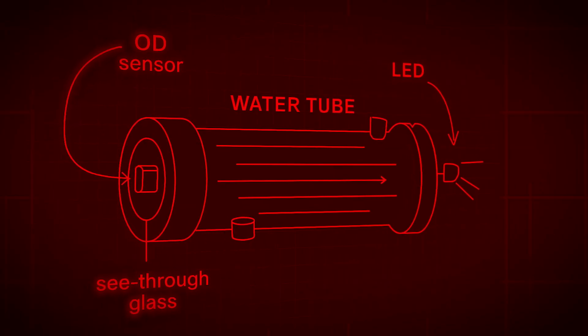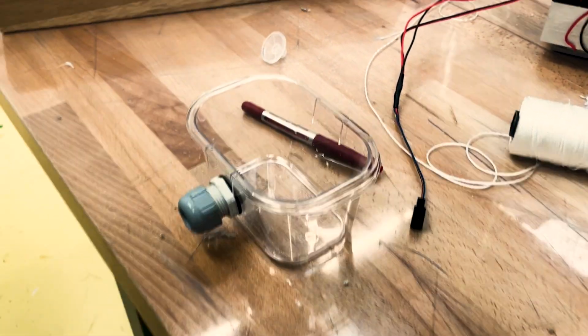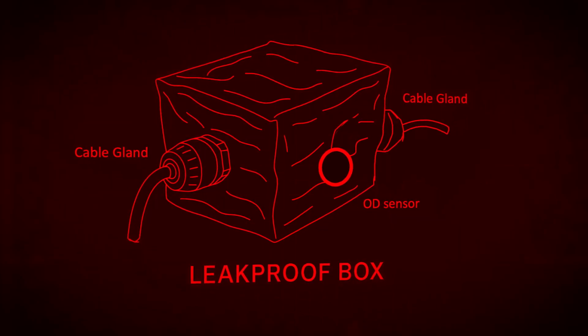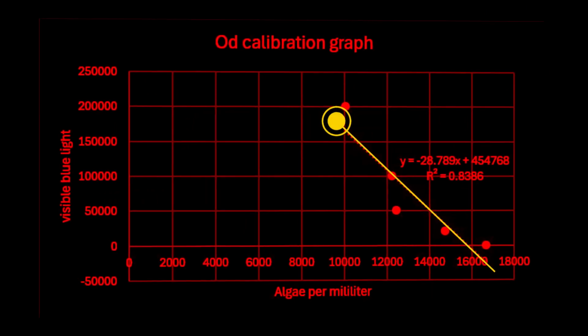Our initial design used a tube with 2 water entry points, but it couldn't be fully sealed. We switched to a leak-proof box, drilled 2 holes and fitted waterproof cable glands. An LED and OD sensor were mounted on opposite sides, and several layers of duct tape were used to block out external light. To calibrate the OD sensor, we measured light intensity through varying algae concentrations. As expected, the sensor detected a clear decrease in light intensity as concentration increased.